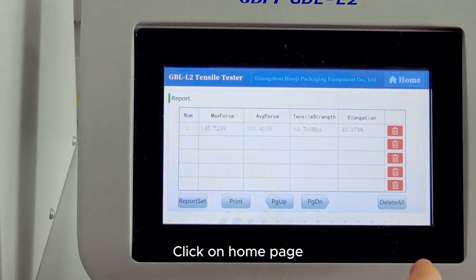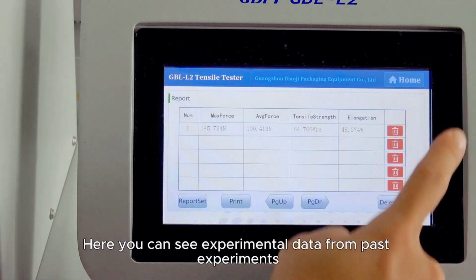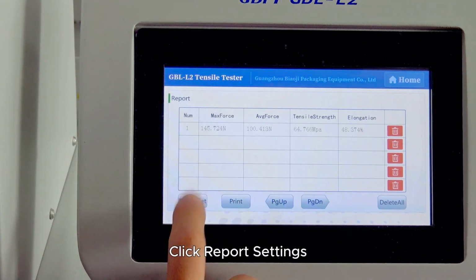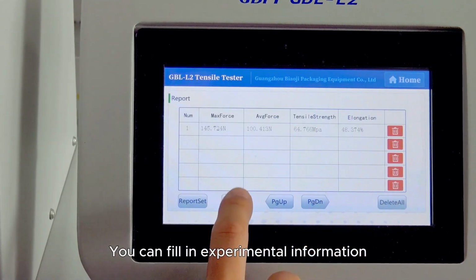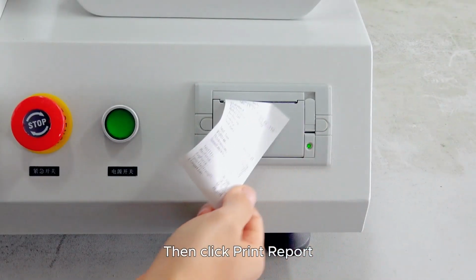Click on Home page. Then click Report. Here you can see experimental data from past experiments. Click Report Settings. You can fill in experimental information. After filling in, click Return. Then click Print Report.